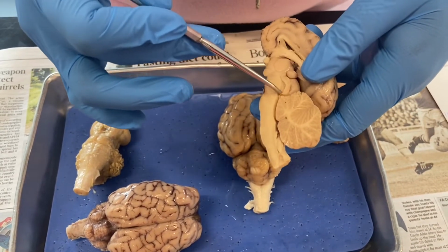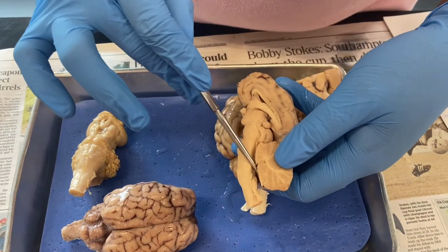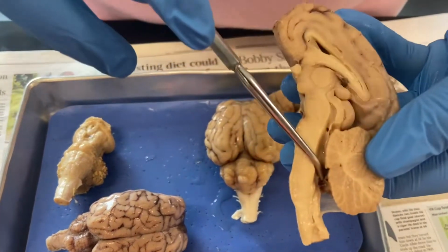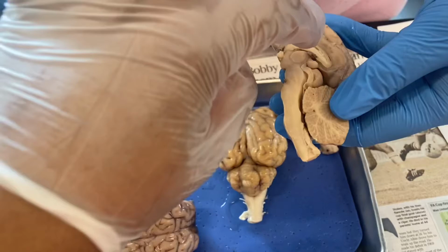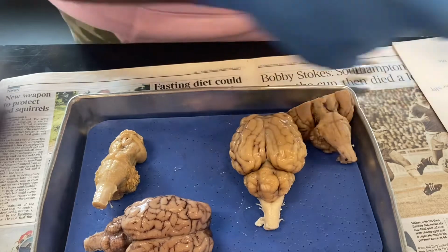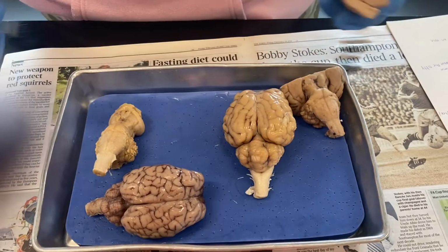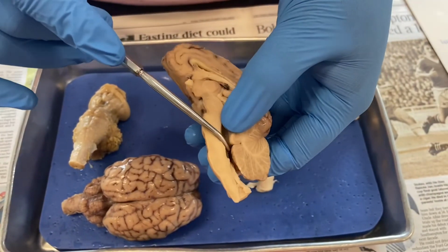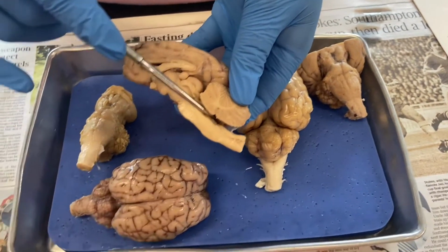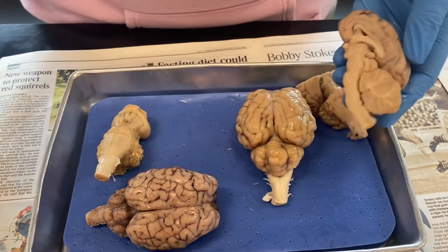This right here is going to be our cerebral aqueduct, which is going into our fourth ventricle, and our choroid plexus, my apologies for lying to y'all, is actually going to be in here. No, it's not. The choroid plexus is up here. Yeah, and there's some in here because it's supposed to be in the fourth ventricle too. Oh, is it? Yeah. See? Fourth ventricle, choroid plexus. So I feel like they just open it up and show that because it's right there. Okay. See it? Mm-hmm. And then I'm going to give them the rundown of this as well.